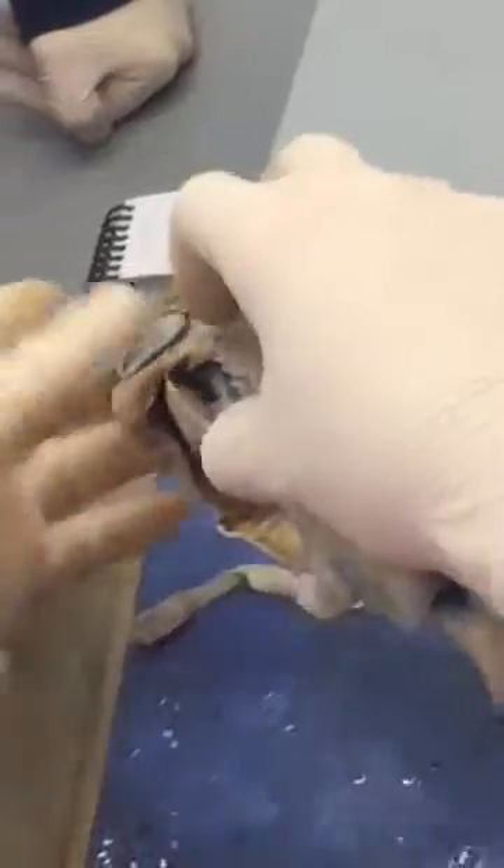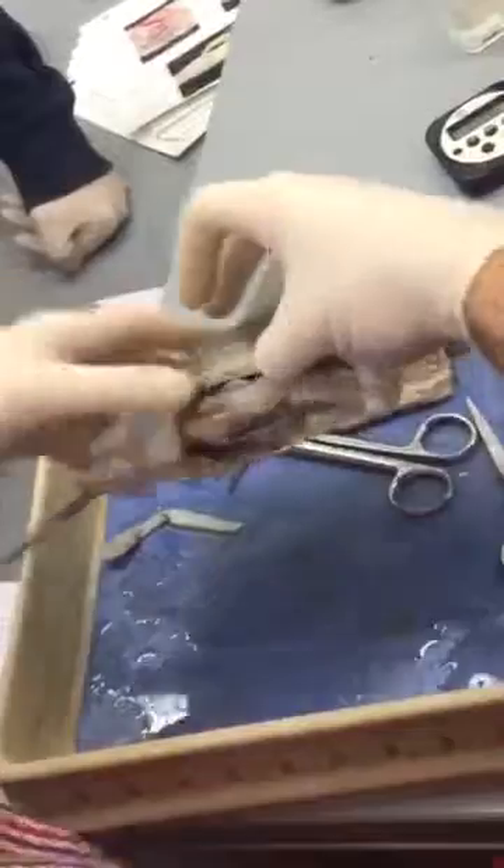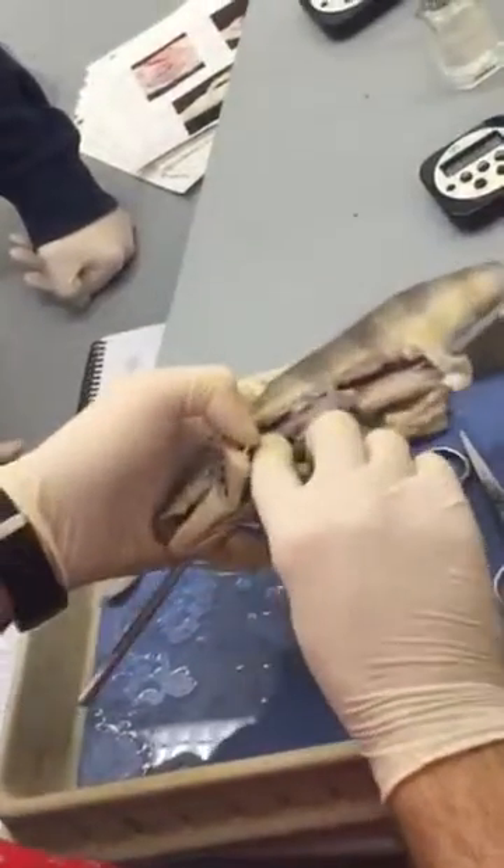See how I'm moving? That's giving me the esophagus. The esophagus is right there. See that? It has the vein all over it. Yeah — this thing right here is the esophagus.